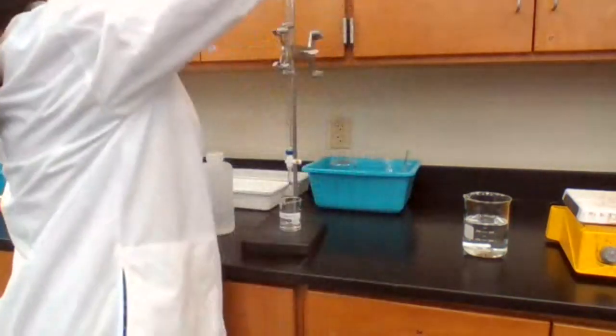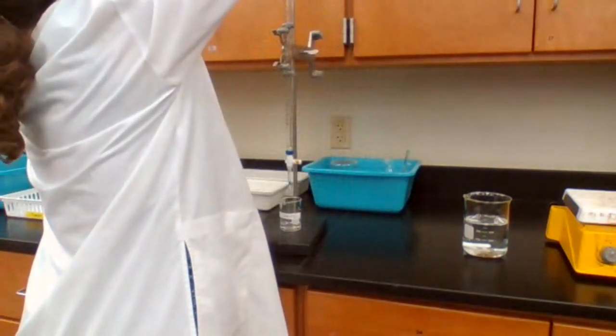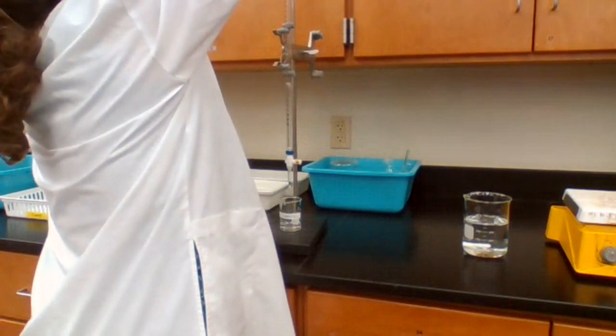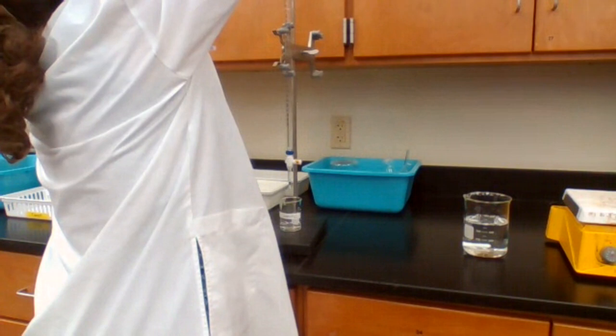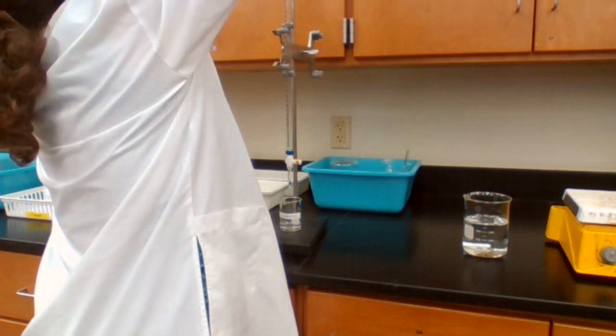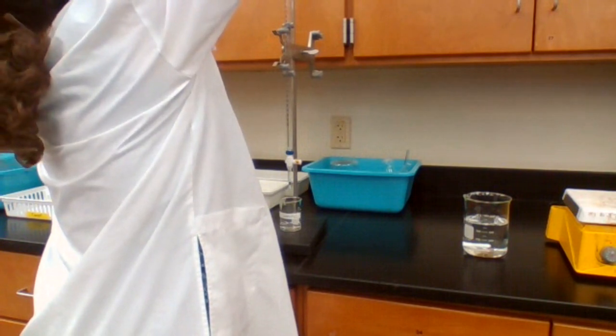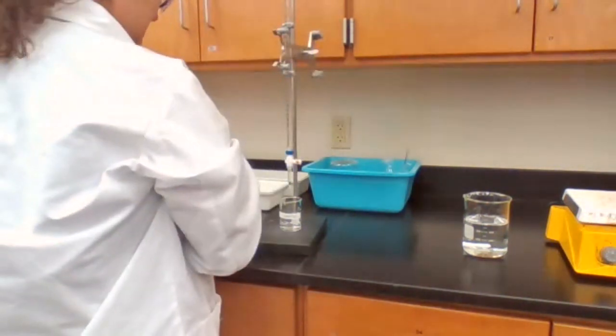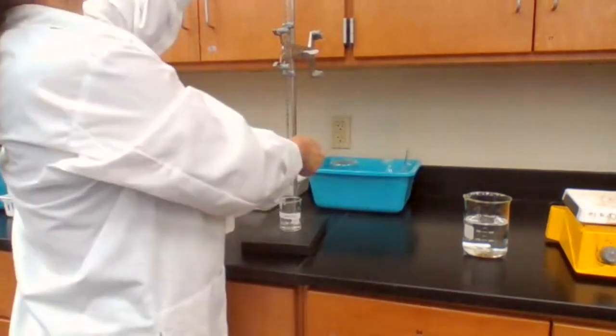Fill it up to 0 or a specific number, but it has to be a fixed number. I'm going to put it more than 0.